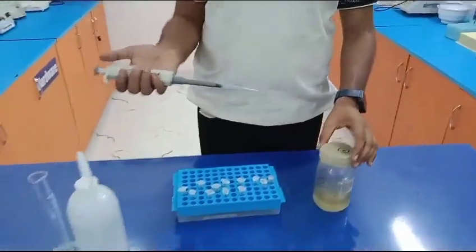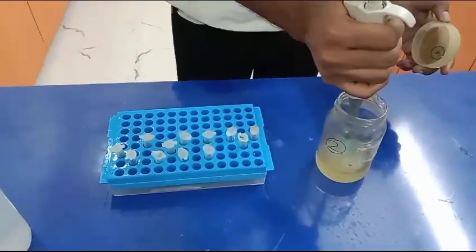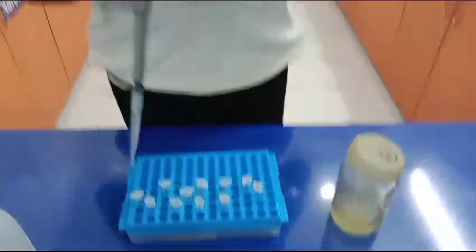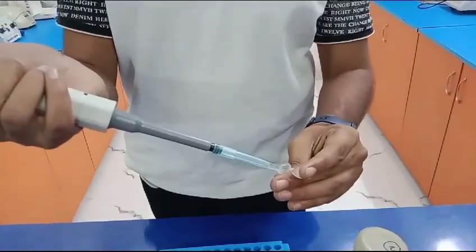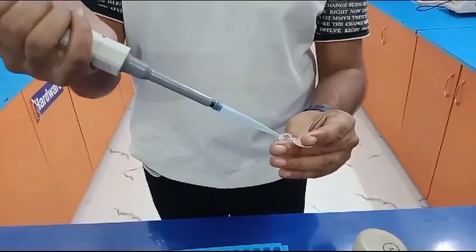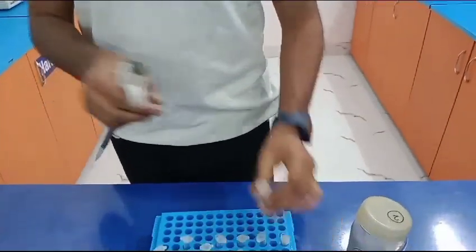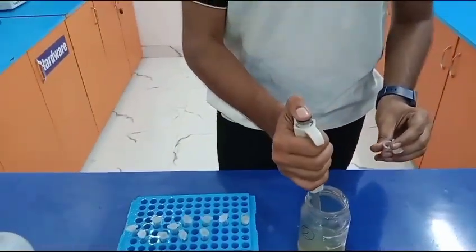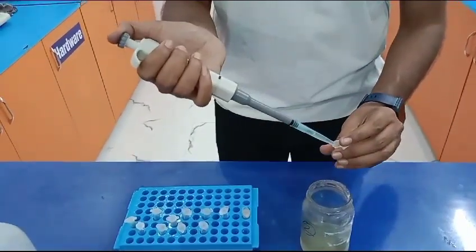I am just taking it out and pouring it. Here I am just pouring 1 ml of this enzyme into each of the Eppendorf tubes to get the purified crude enzyme.